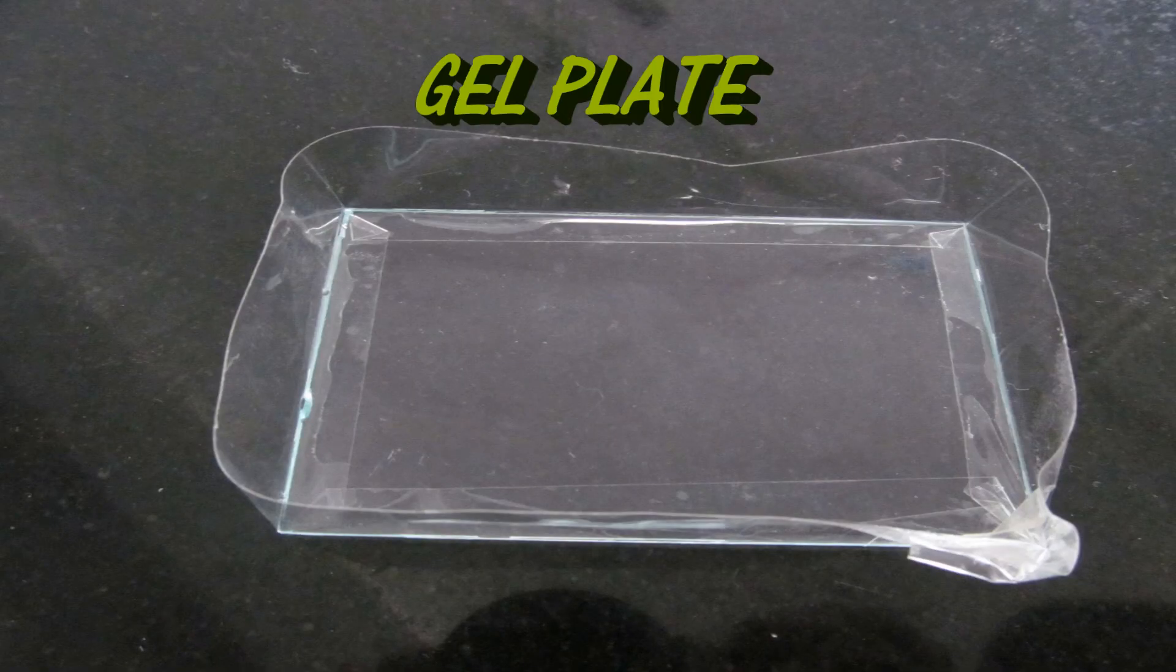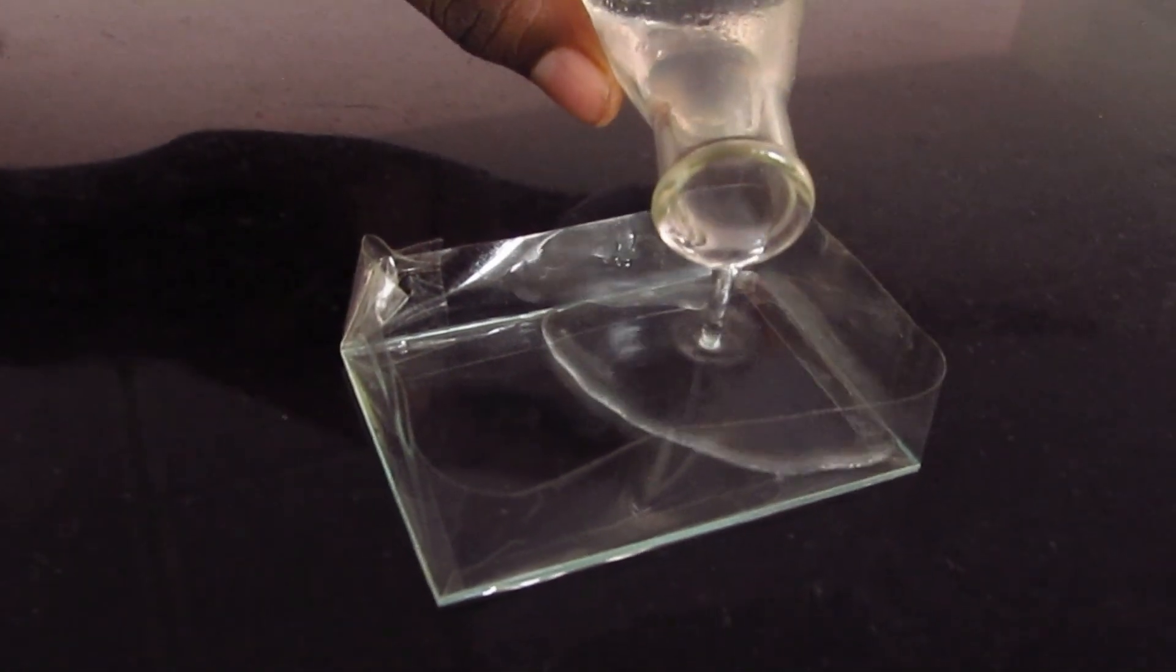Wipe the gel plate with ethanol and cover the edges with tape. Pour the gel into the gel plate.